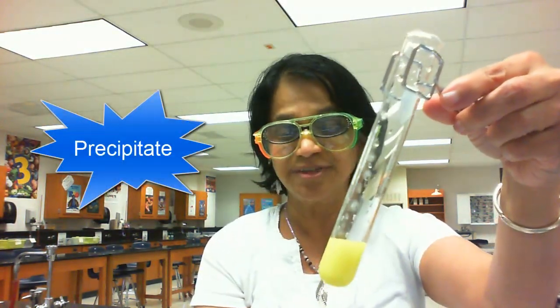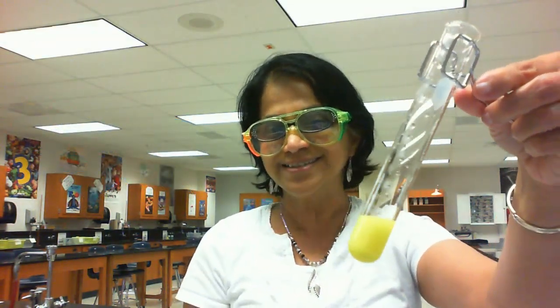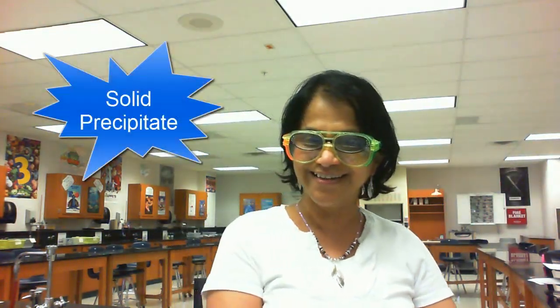A precipitate is something which suddenly forms when two or more liquids are mixed up, and it is a solid which is formed in that liquid layer. So this is an example of chemical change and chemical reaction. What did you observe? Our both chemicals before were colorless, and what we ended up getting was a yellow solid. So we saw a change in color. We also saw that by mixing liquids we got a solid. So there we go. We learned one reaction, and from that the two indicator factors for a chemical reaction.